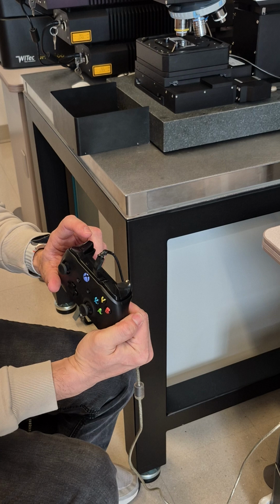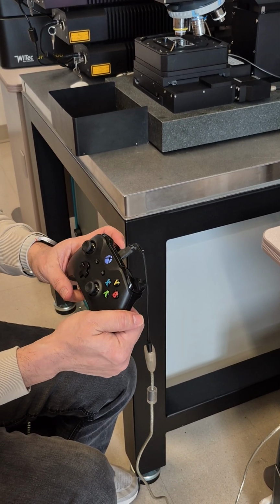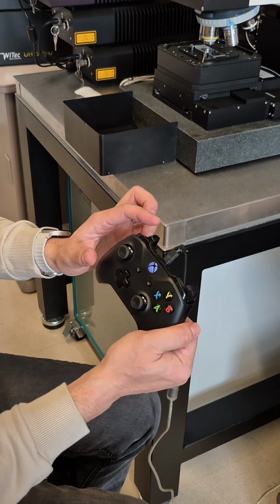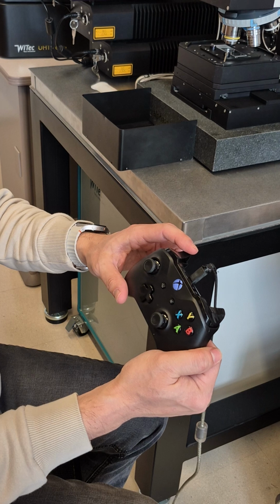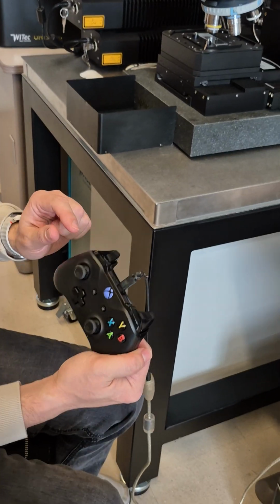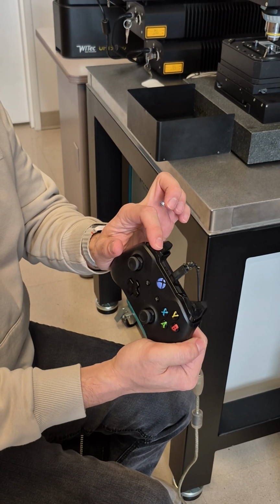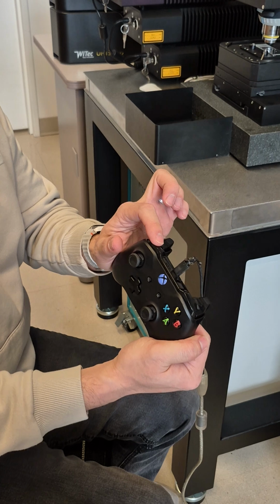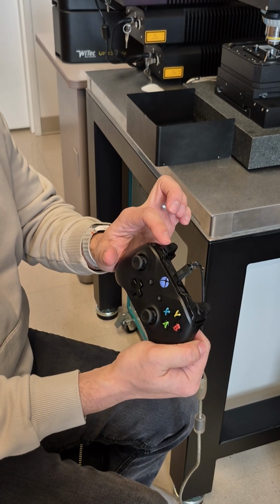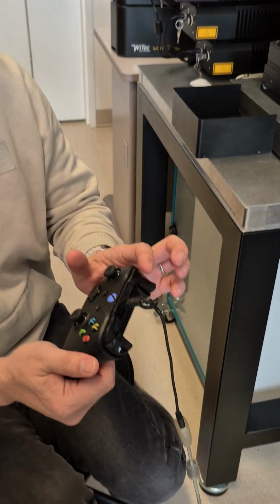And if you hold this one, and then you hold this one up and down, that becomes a continuous move. So it's a little bit dangerous, especially if you want to move down. You don't want to use continuous for too long, because it can crash on your sample. More dangerous is the upper one. This is also continuous, called turbo continuous. It's much faster than the bottom one. So I suggest that before you become an experienced user, try not to use this one.